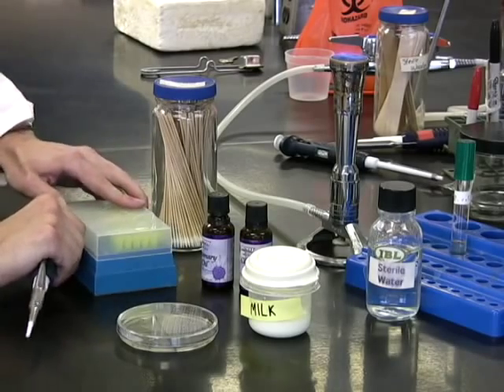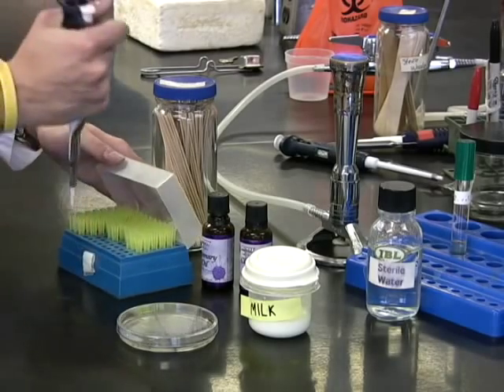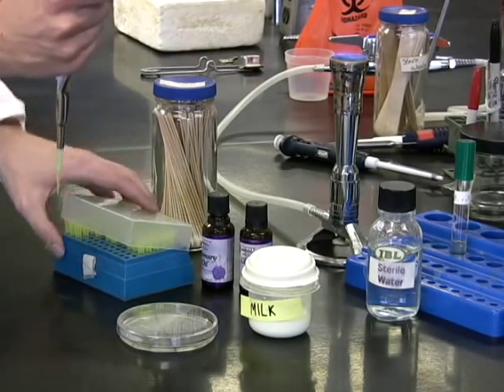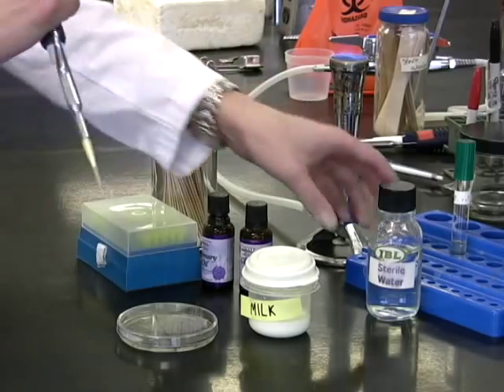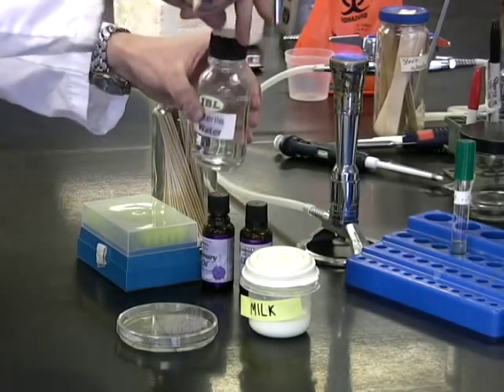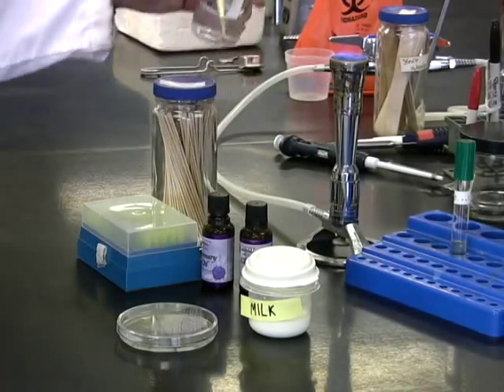In the quadrant labeled control, pipet 5 microliters of sterile water into the center. You'll want to be sure to allow five to ten minutes for the plates to dry before moving them.